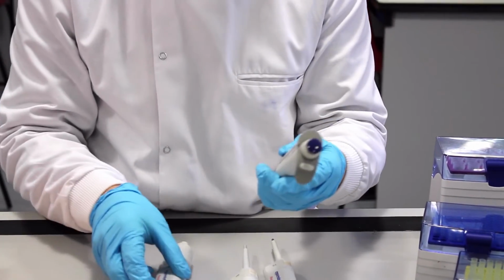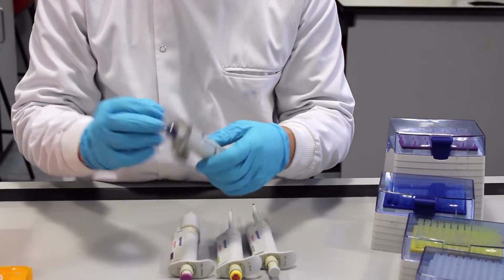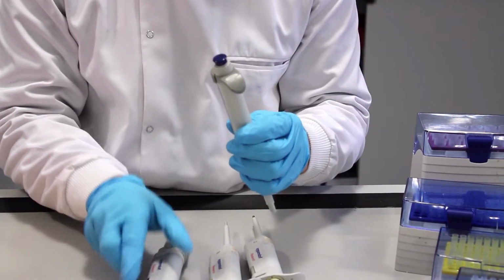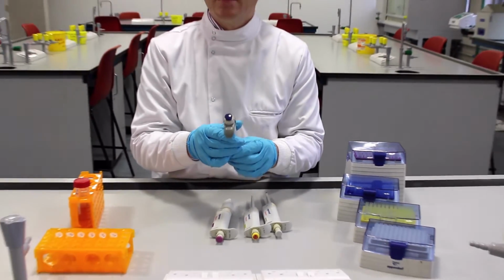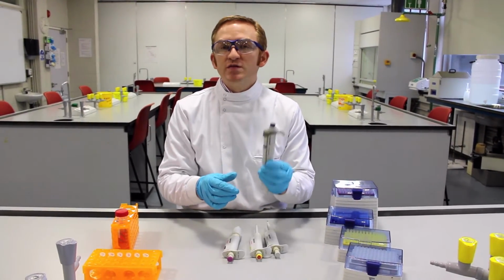Now sometimes, varying on the brand, you might see it listed on the side or you might see it mainly on the top in the pipettes that we have in the department. So once you've selected the correct device, that's half the battle. You're not going to make a major error in any of your pipetting. Now we have to learn how to use this correctly.